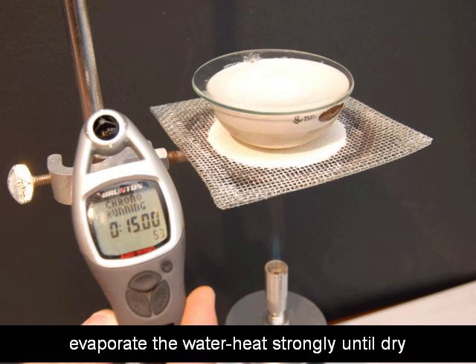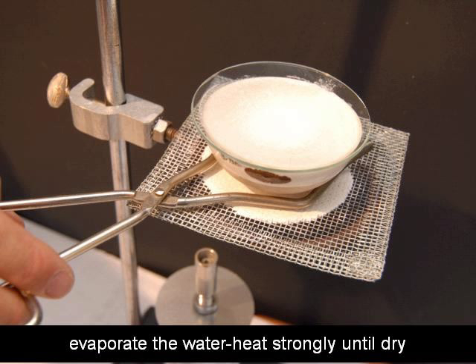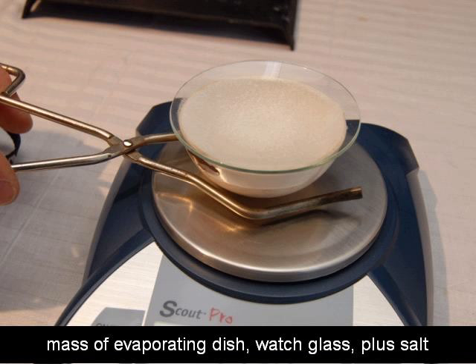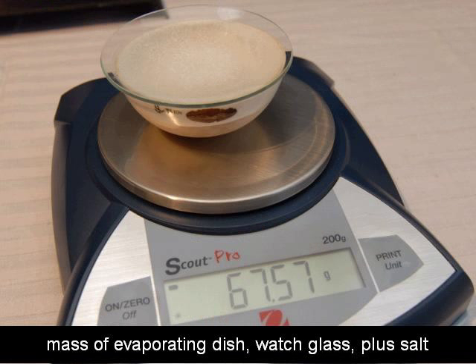I let the evaporating dish cool for a few minutes. But still, it takes a long time for the heat to be released. But if you have a digital balance with a stainless steel top, you can go ahead and put the evaporating dish on, even if it's too hot to pick up with your hands. So you can use the crucible tongs, just put them underneath. Carefully place the evaporating dish watch glass and salt on the balance. And record the mass, 67.57 grams in this case. And then you're finished with the experiment. Go ahead and let it cool off before you try to clean up anything. And all you have, it may look like a mess, but it's just dried up salt. And so you just rinse it off with water. And your watch glass and evaporating dish will clean up quite easily.